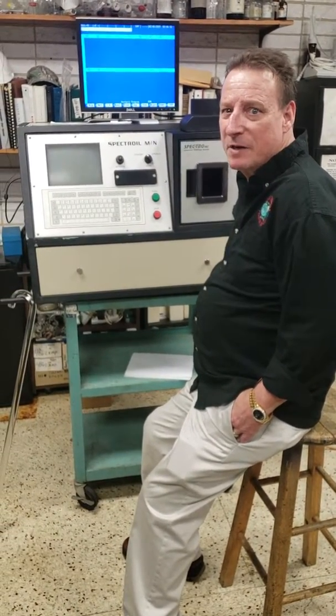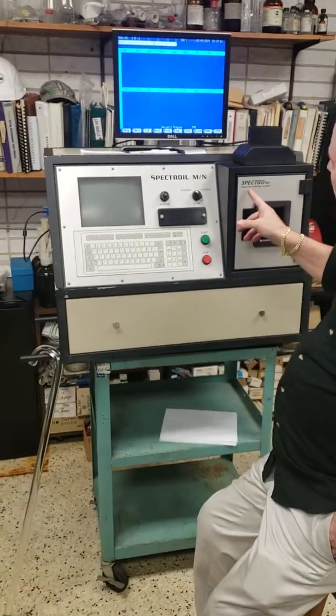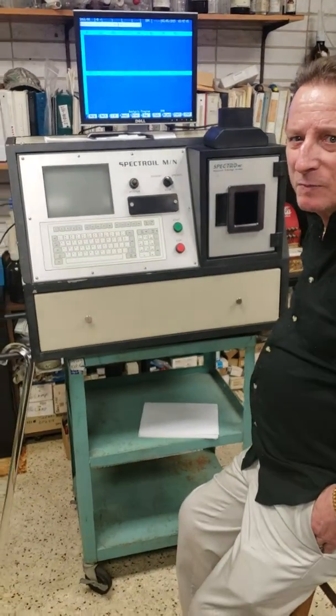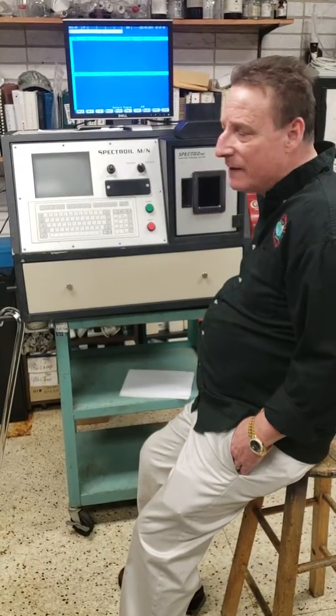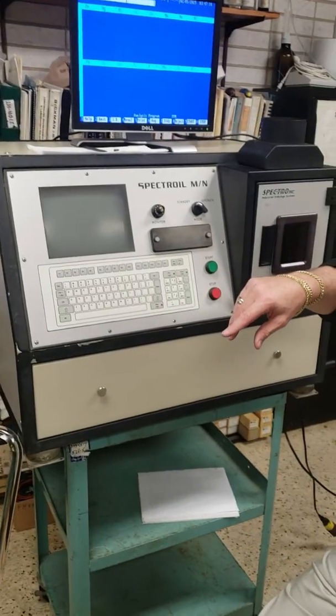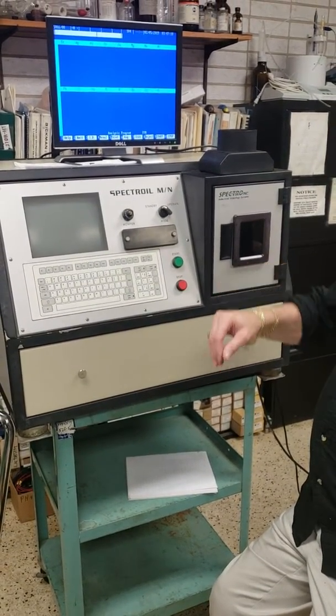Today we're doing a demonstration of a Spectroil MN industrial tribology system. This is the second video. The first one we did was for a 2001 machine. This one is a 2000. What this does is it analyzes particles of metals, parts per million in oil.